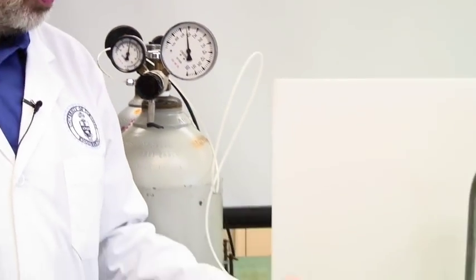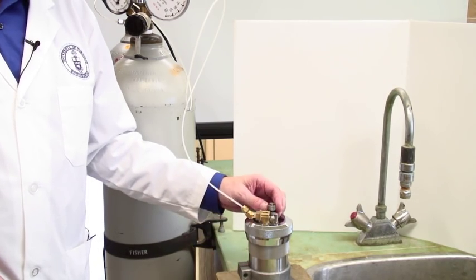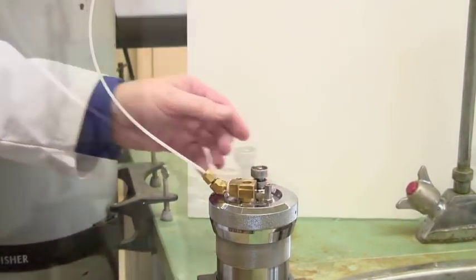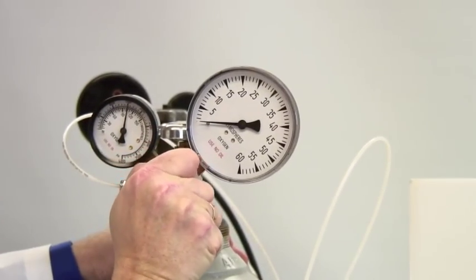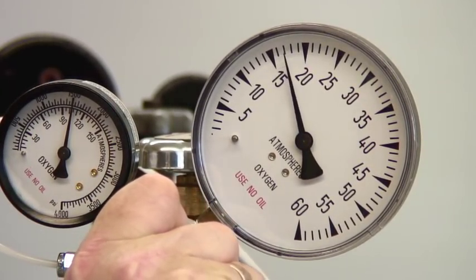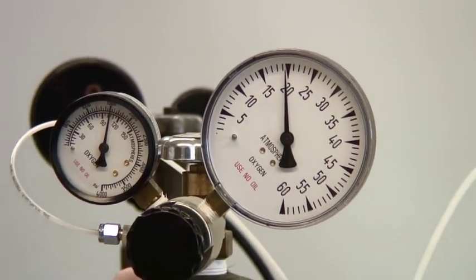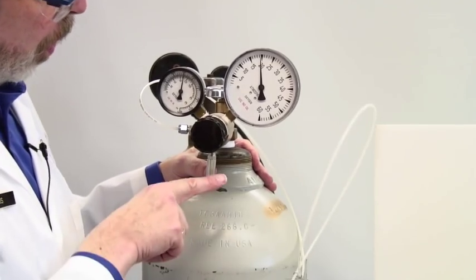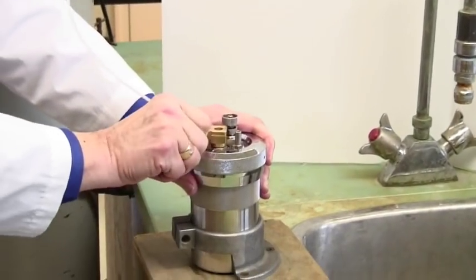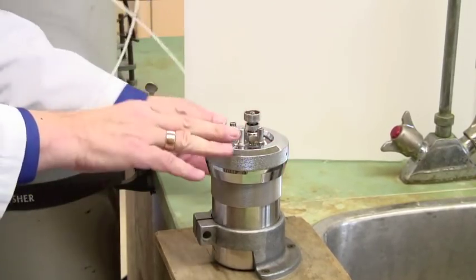And then for the first one, discharge it. And then you would charge it again. Once you have purged it, you can then charge the bomb properly, ready for firing. Up to 20 atmospheres. If by mistake you end up with 25 or 30, no problem. Just discharge it and we'll move on. This is now ready to fire. And so, again, I push this lever, which depressurizes the line. And then the brass fitting just slides off. And this bomb is now ready to fire.